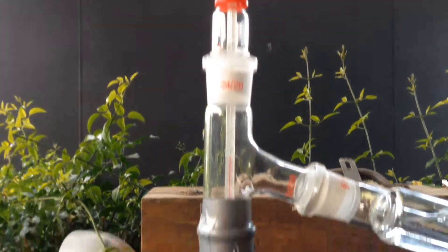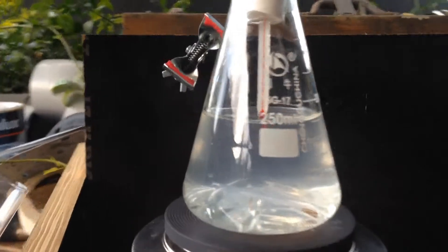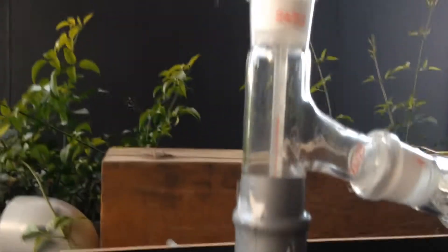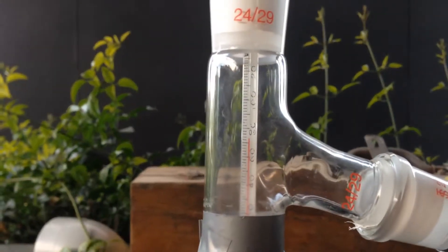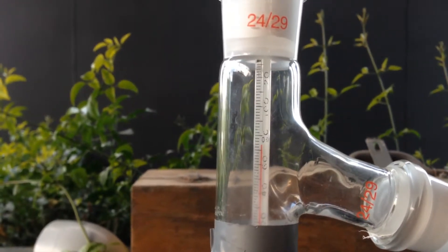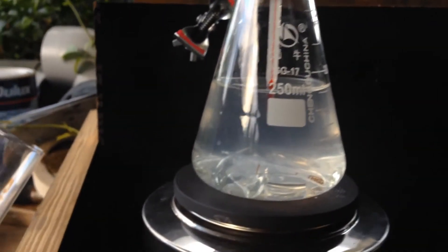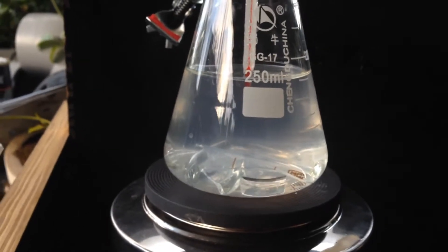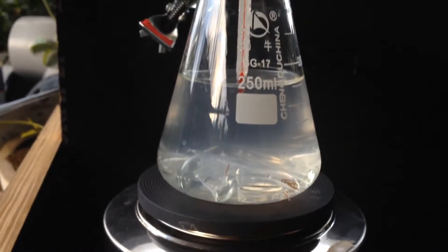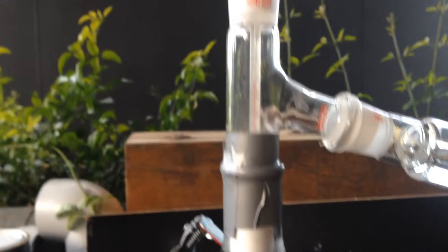So I lowered the thermometer down into the water, as you can see. And it's reading already after just a couple of minutes, nearly 80 degrees, and it's steadily rising. You can see the water's almost boiling down the bottom. All the glass pieces are moving around. So pretty soon we should start to see stuff boil over.